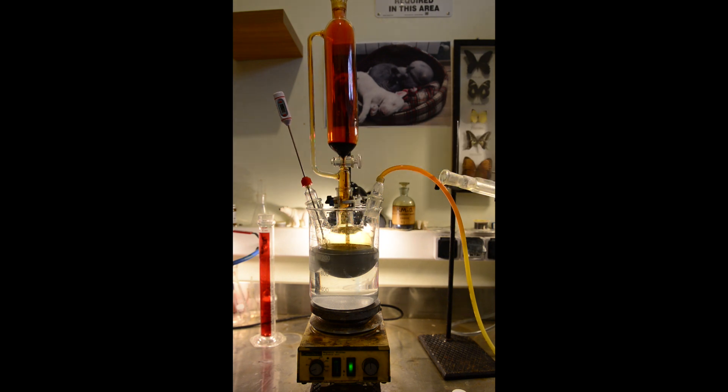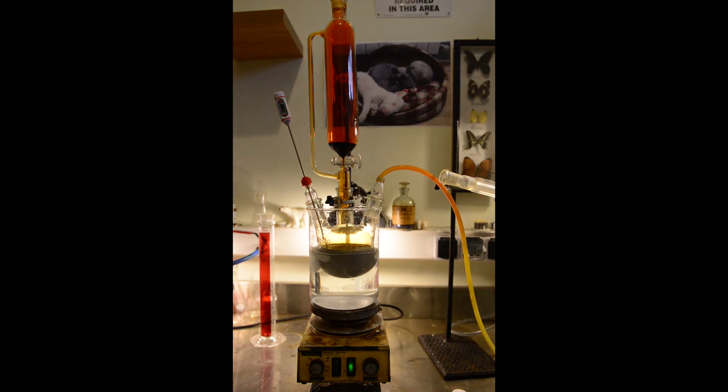But here I am dripping bromine and controlling the temperature meticulously. In the beginning the reaction takes some time to start but as I am progressing with bromine addition the temperature starts to climb up. The patent mentions that amalgamation of aluminum with mercury or copper salts helps a complex to be formed. But as I have got very fine powder I will try to skip this step.